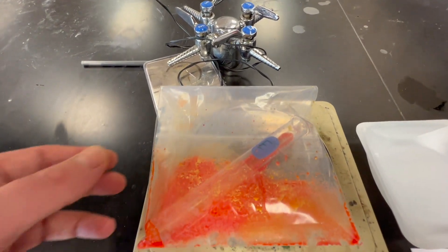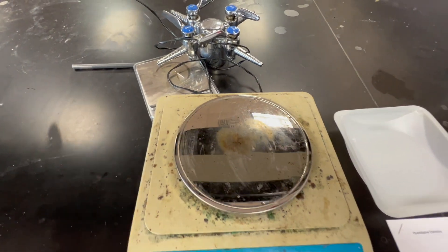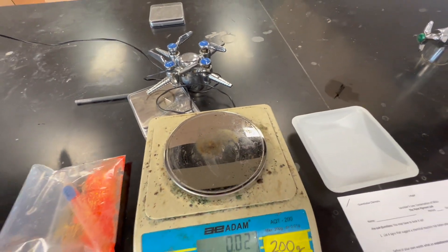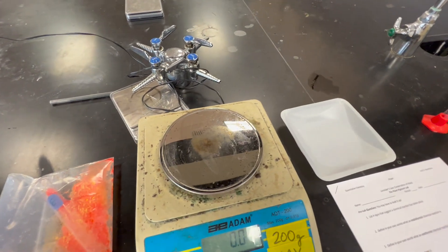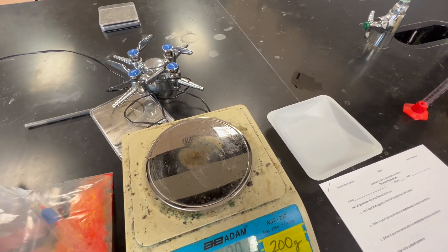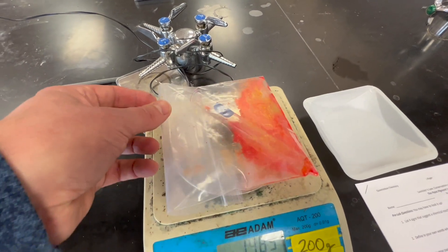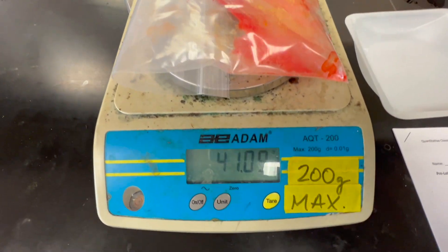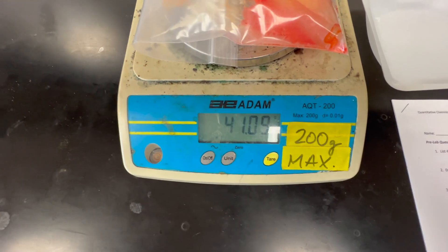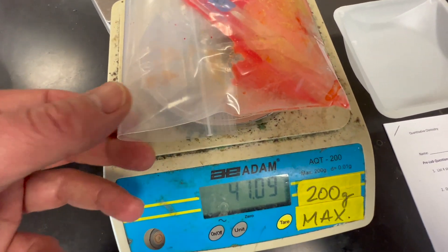Make sure that you think about that, as it is one of the questions on your lab. Also, after the reaction the mass was 41.17 and now it is down to 41.09.